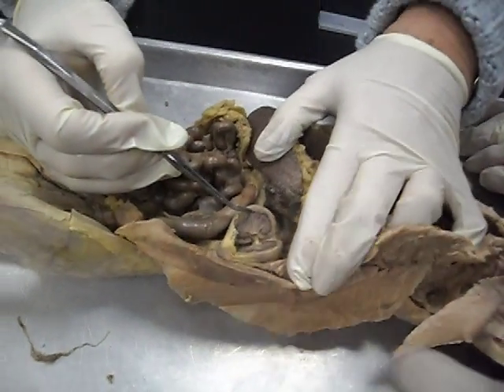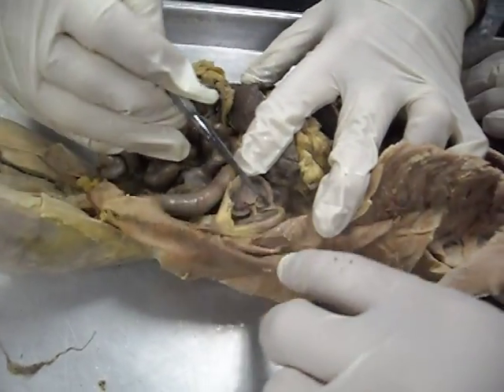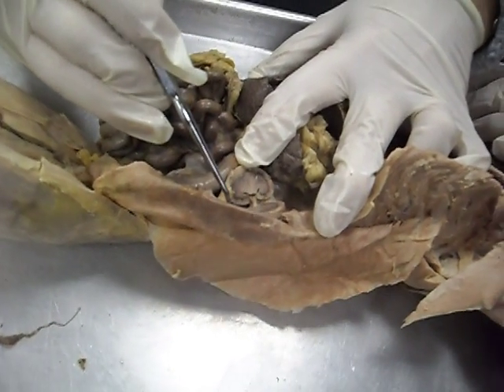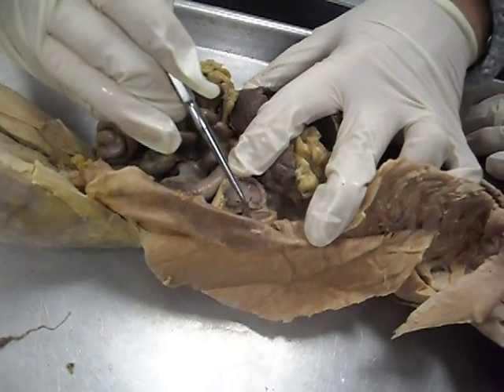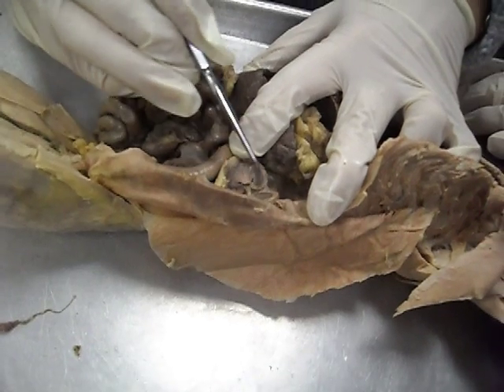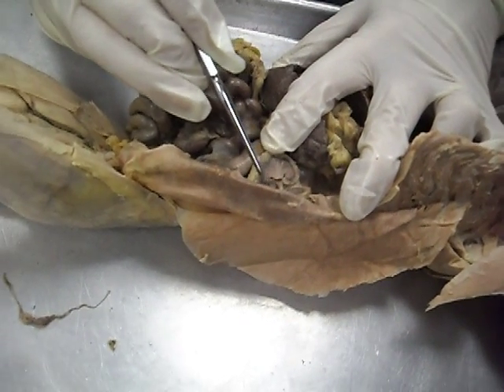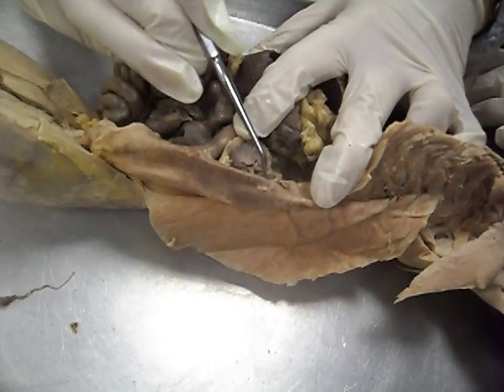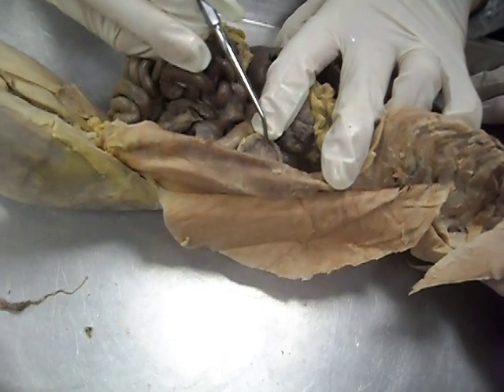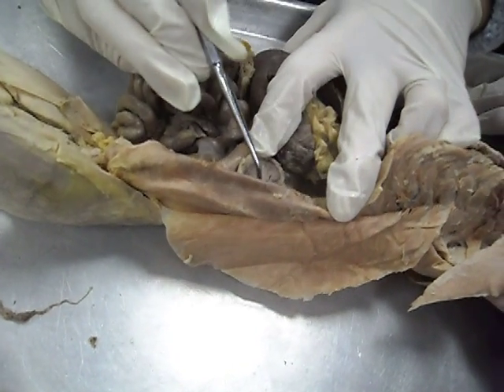When we open the kidney, you can see the cortex, and here would be all your nephrons. And then here's the medulla region, and those little pyramids are here. So those would be your pyramids.